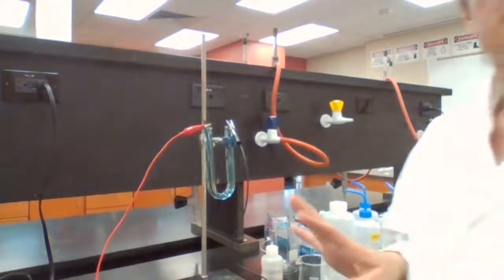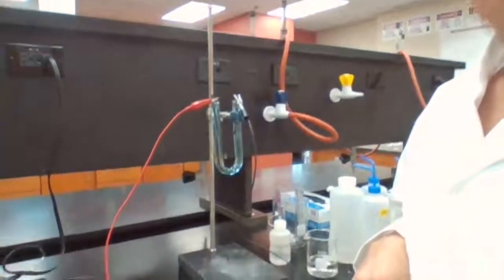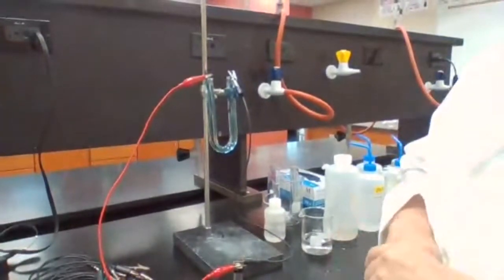Just waiting. Nothing is being done really. Just waiting for the reaction.